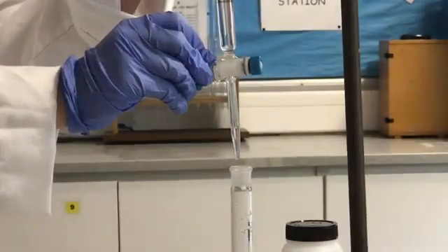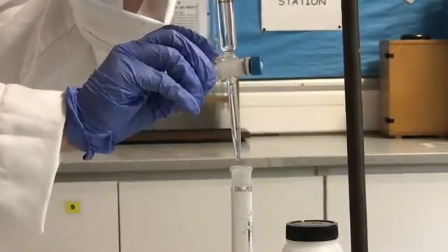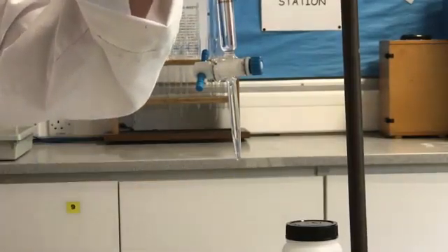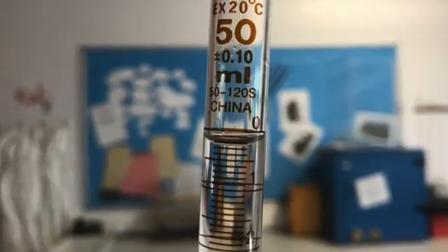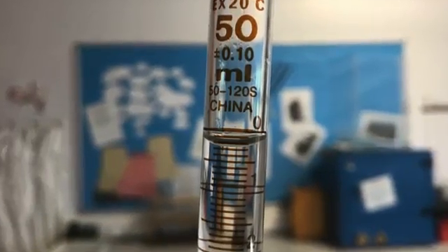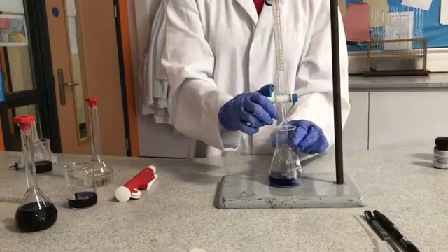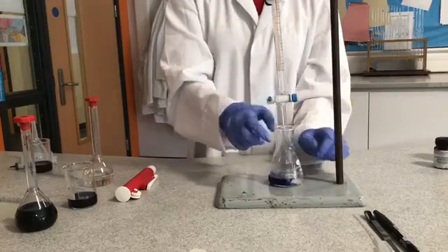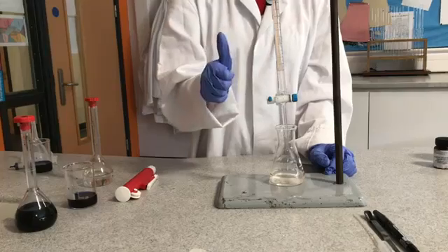Allow excess solution to flow through the burette. Ensure the bottom of the meniscus is level with the zero graduation. Allowing excess solution to flow through the burette ensures the burette is conditioned beyond the tap. Discard the excess solution as this may be contaminated from previous use.